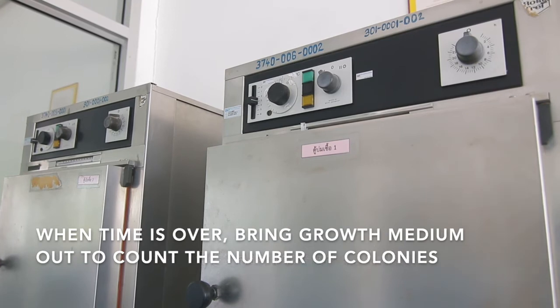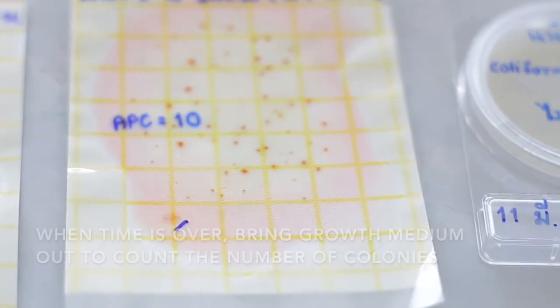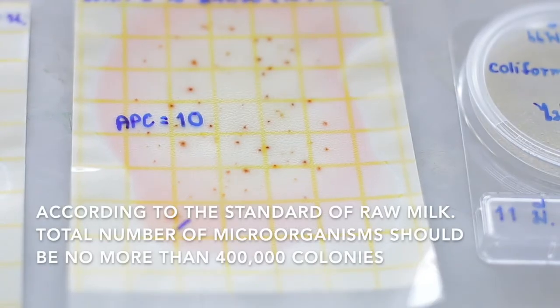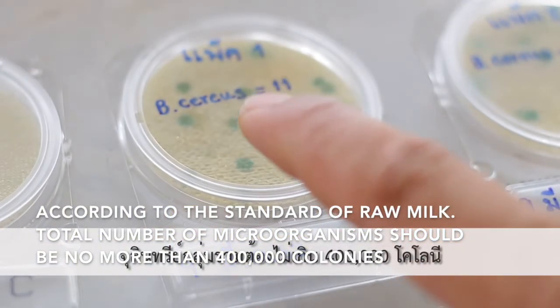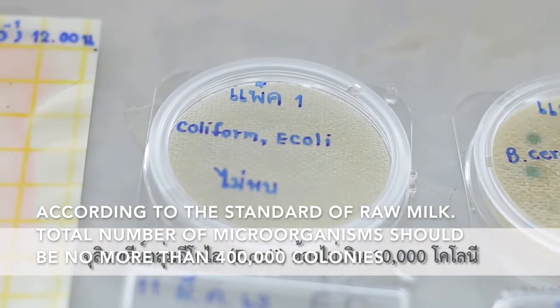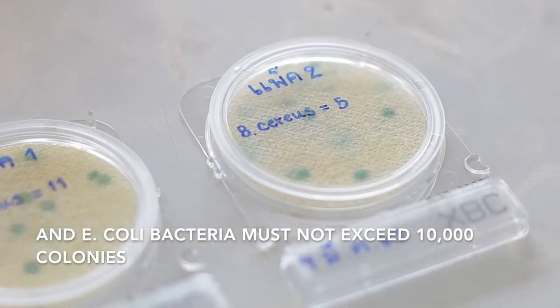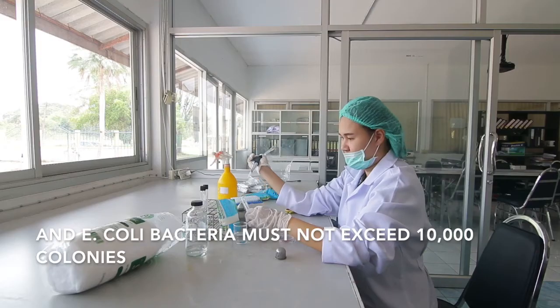When time is over, bring the growth medium out to count the number of colonies. According to the standard of raw milk, the total number of microorganisms should be no more than 400,000 colonies. E. coli bacteria must not exceed 10,000 colonies.